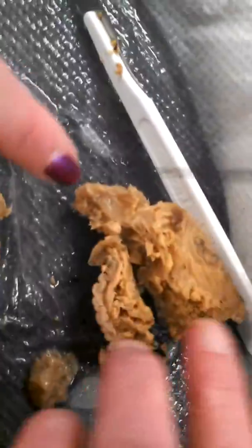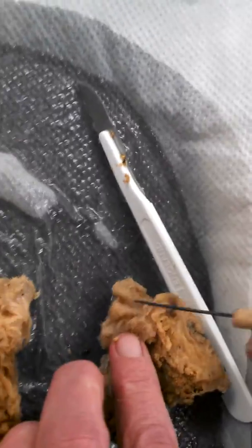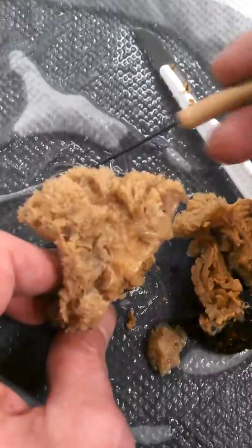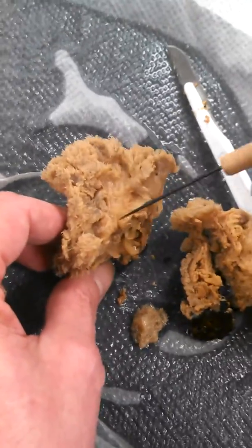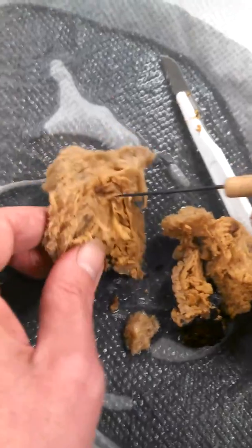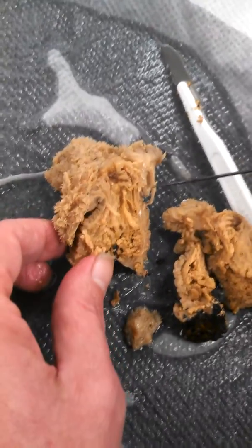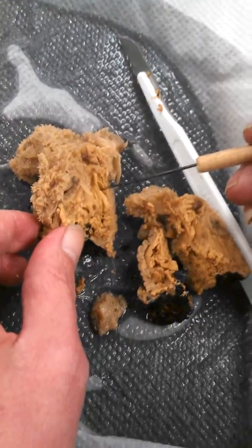These are the tentacles up here — those are the tentacles. We saw that in the initial view of it, which you saw when it was upright. There's a still photo of that. We basically sliced straight through the center of the oral opening, the mouth here. I think that's all we have to identify — that's pretty much it.